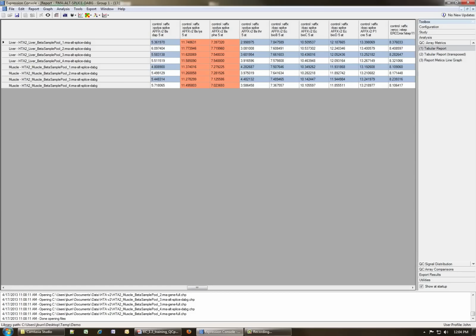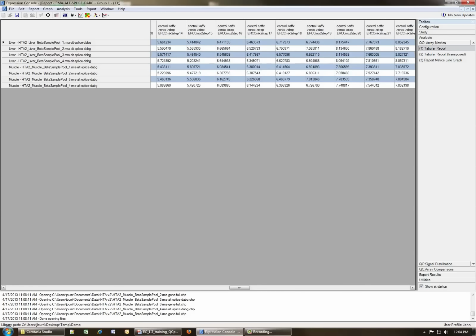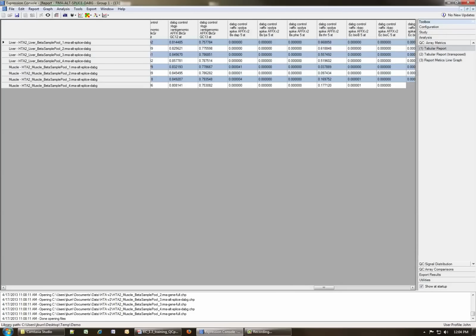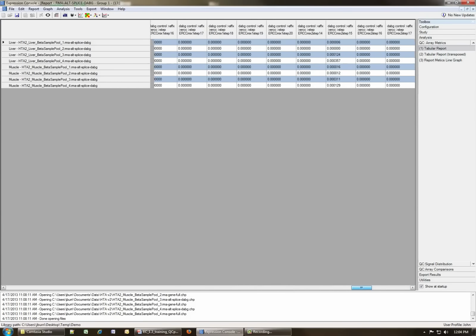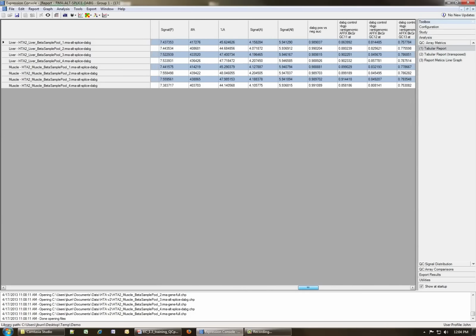In this sample data, we used both the labeling controls and the ERCC mix 1, and you can see that in fact, yes, these probe sets are not following the expected behavior. So let's continue to scroll across and see if anything else is in orange, or whether that is the only cause for the outliers. So okay, since we know what the problem is with these and it was an expected thing, the QC metrics look pretty good in this case.